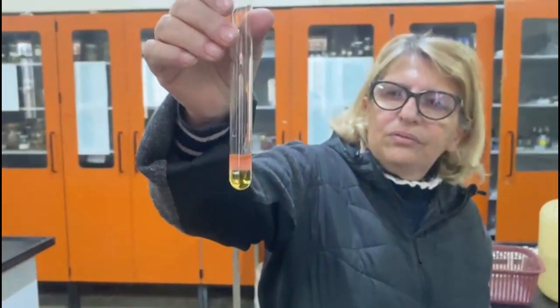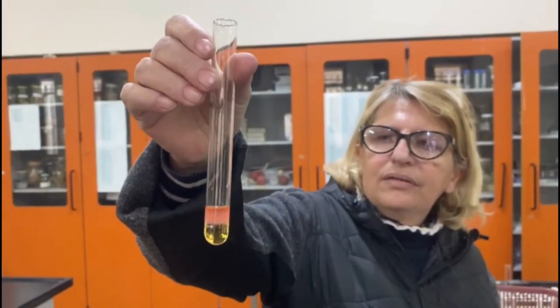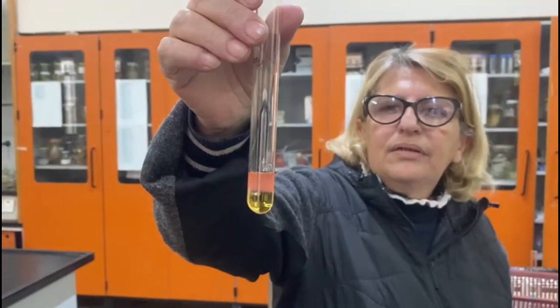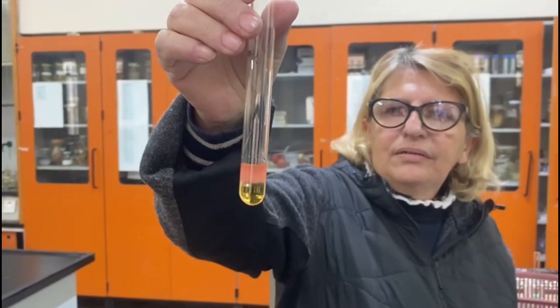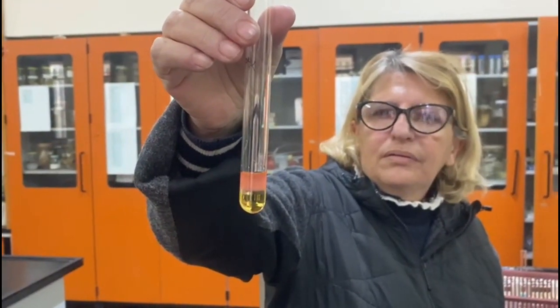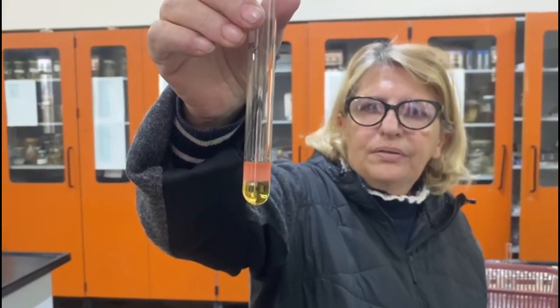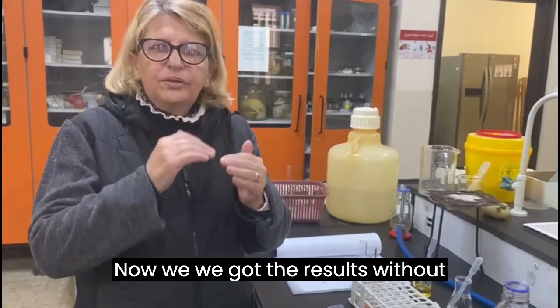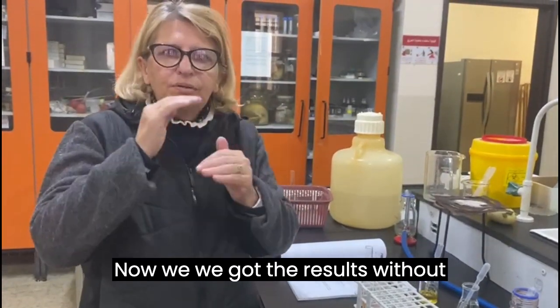And here, the Sudan 3 has, on the other hand, stayed with the xylene, in the top part of the test tube. Now we got the results without mixing.